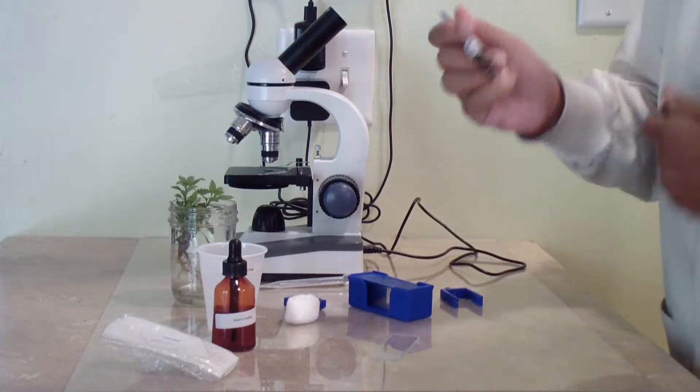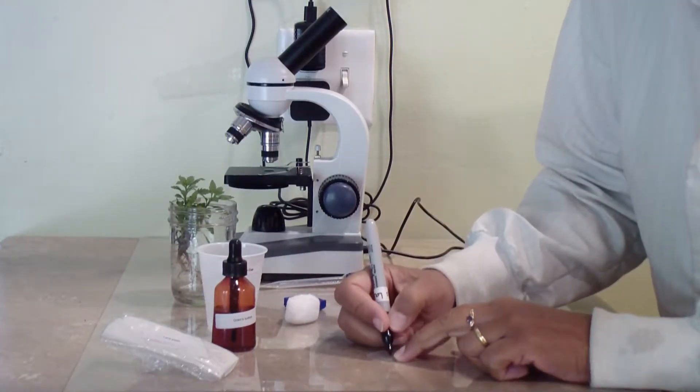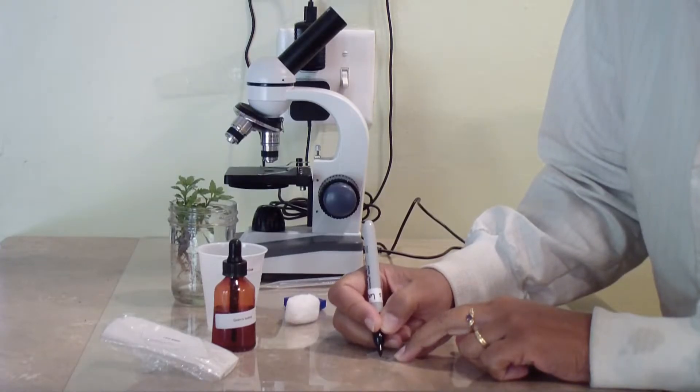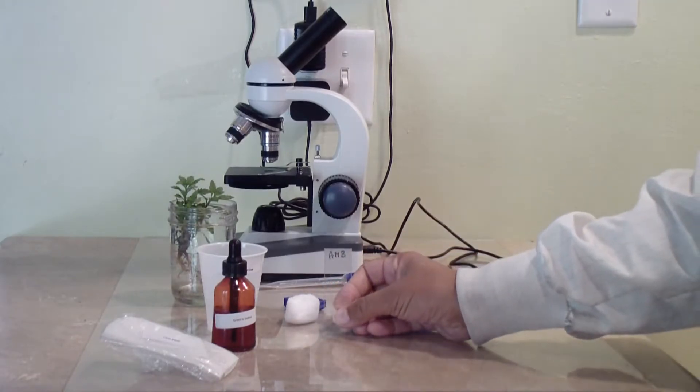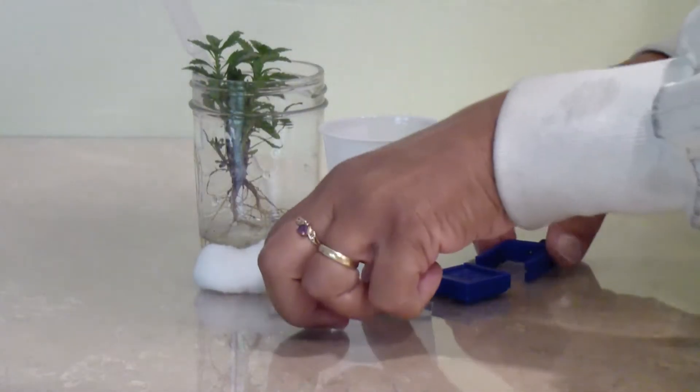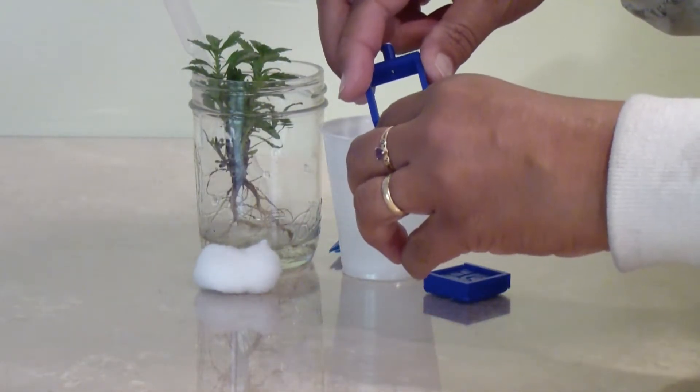Start by labeling the glass slide with your initials near the edge of the slide. This is not strictly required, but it is a good habit to get into.